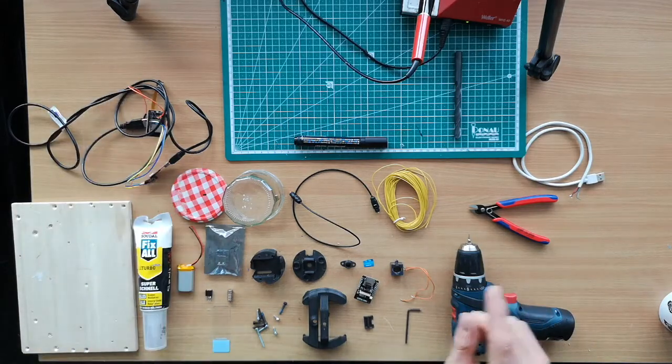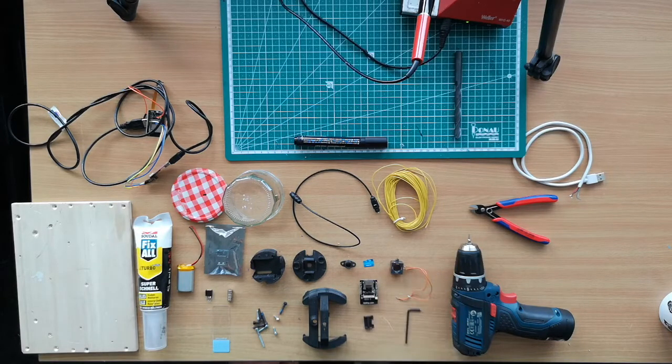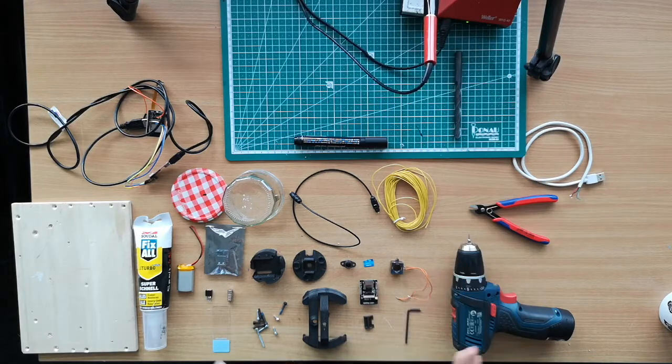So I'm assuming you already flashed the ESP32 prior to the assembly, so that we can start with the assembly right away. Once you've assembled it, it's rather complicated to also flash it since it's enclosed, even though we also provide you an over-the-air update, so everything becomes a little easier. So we require you to have some soldering skills, but the rest should be rather simple. All right, so let's start with flashing the firmware.